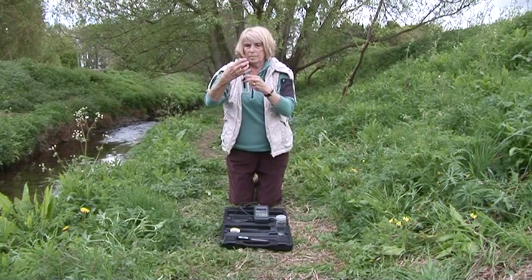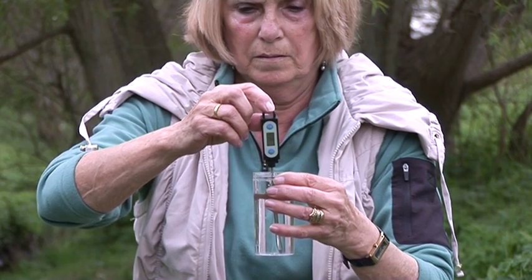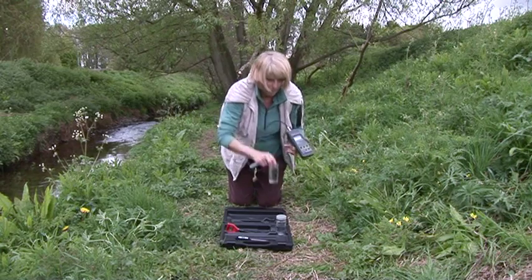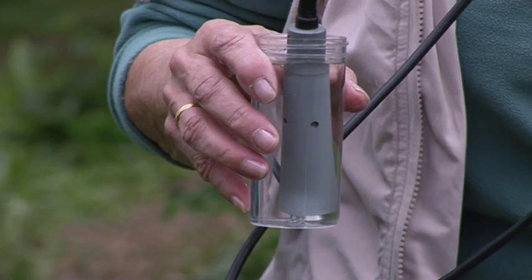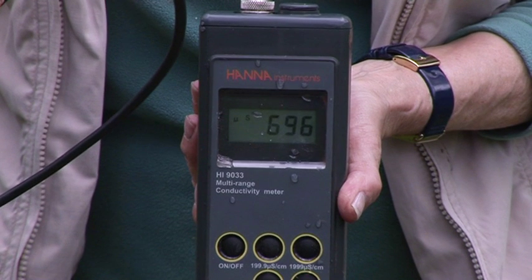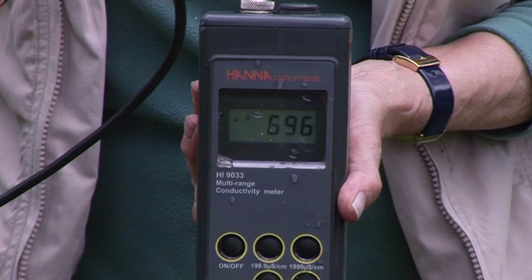A digital thermometer is used to measure water temperature, and results should be in degrees centigrade. A conductivity meter is used to determine the conductivity of the water sample and is recorded as microsiemens per centimetre, the SI unit for conductivity. Conductivity indicates the total of all anions and cations present in the sample.